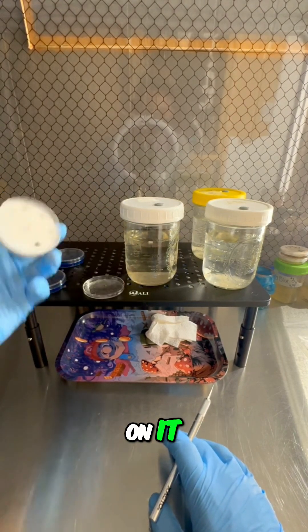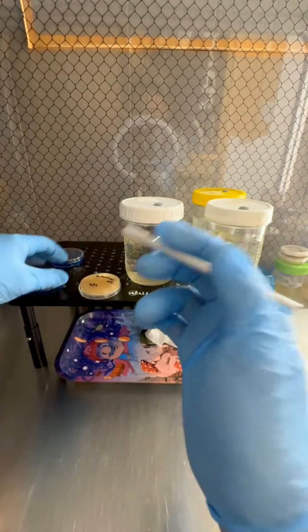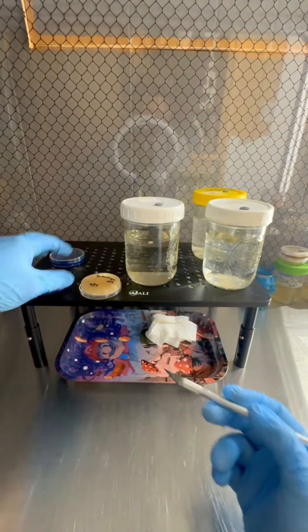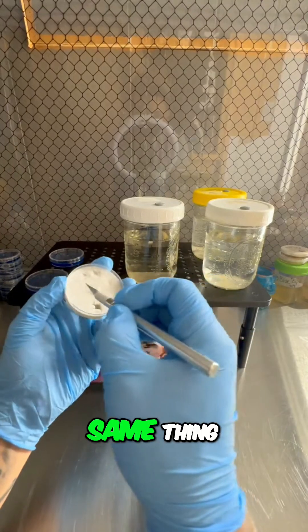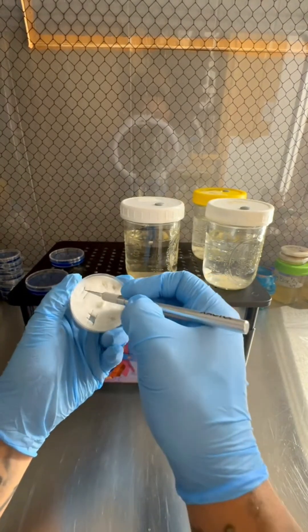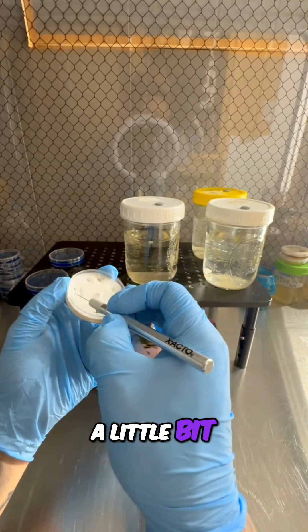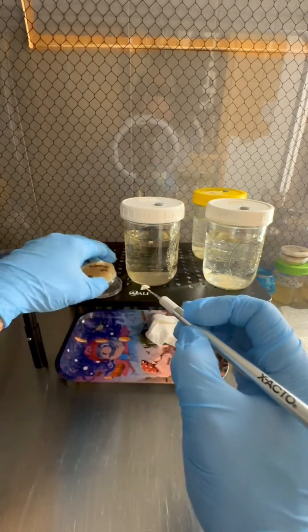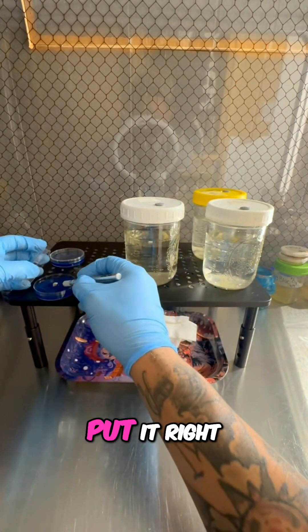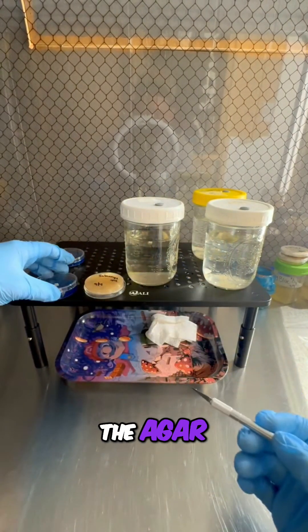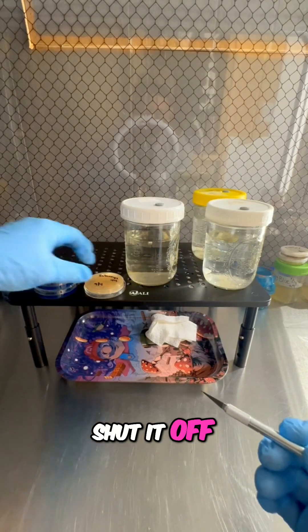Just make sure this is cool. Same thing, all you need is a little bit. Put it right there on the petri dish, right there on the agar. Shut it off, get the next plate ready.